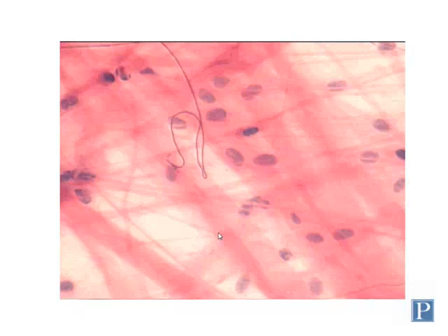Visualizing reticular fibers requires a specific type of stain to be able to see them. So we'll look at some tissues here in a little bit that have been stained with a silver stain, so you can actually see those. So know that areolar connective tissue has all three fiber types: elastic, type 1 collagen, and reticular fibers, but you can only see two of those when stained with H&E.